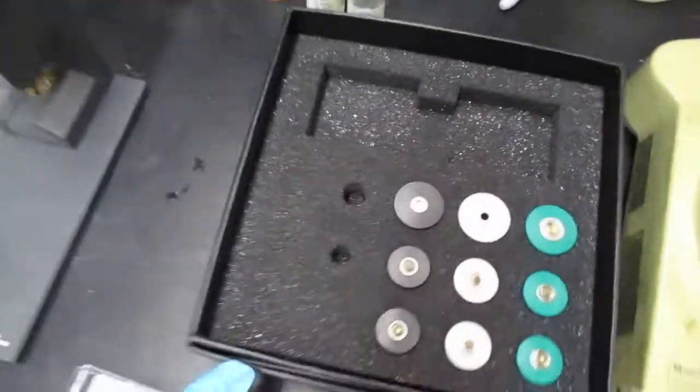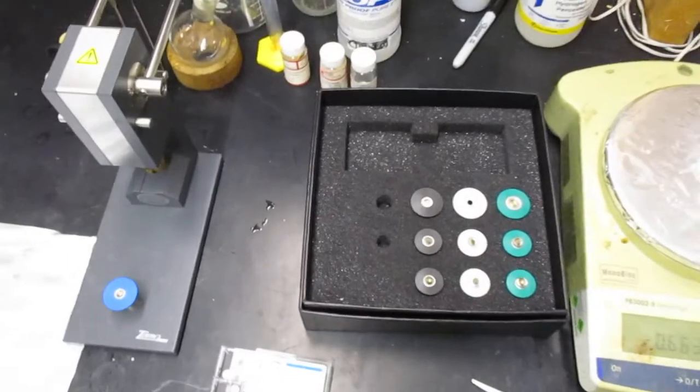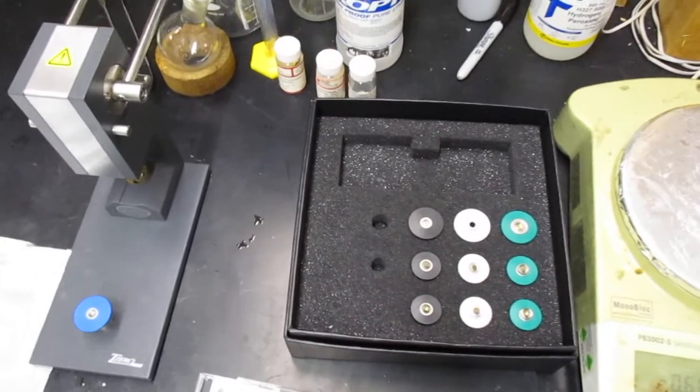Now this press and all of these pieces can be found in the room where the DSC is, which is room 320 upstairs.